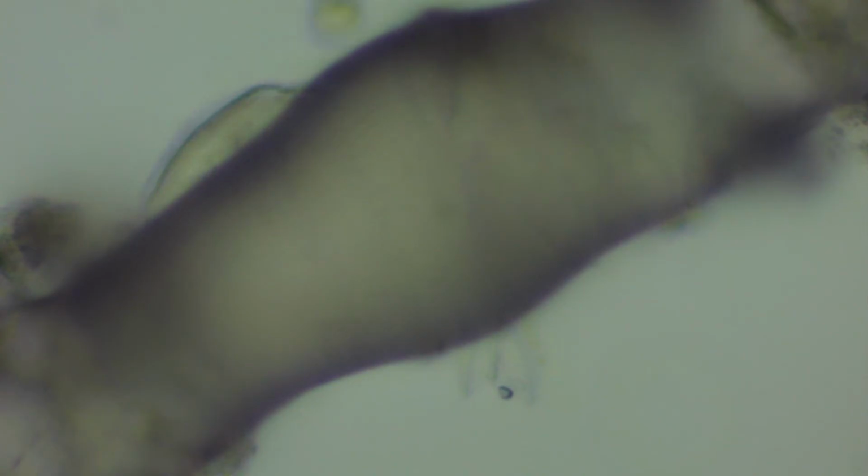I did encounter another organism. However, I found it impossible to identify since it did not move from its location for over 2 hours. Please comment down below if, by this video, you can identify the microorganism. It appears to be feeding on decaying organic material, but there's also a possibility it was trapped under this particle when I placed the cover slip on the slide.